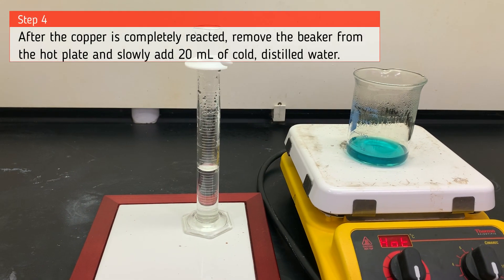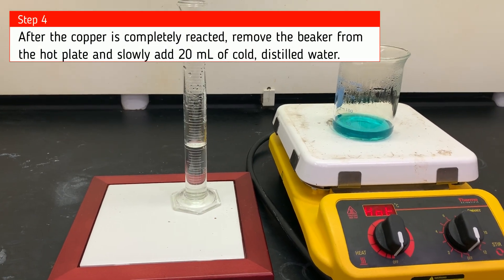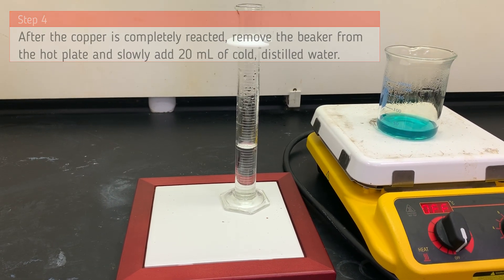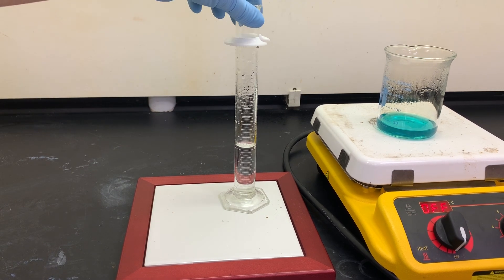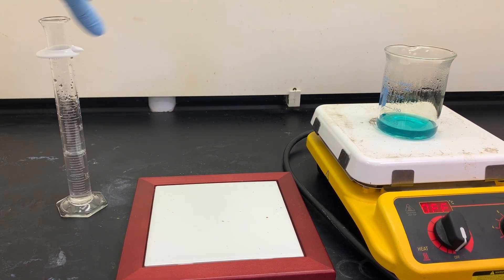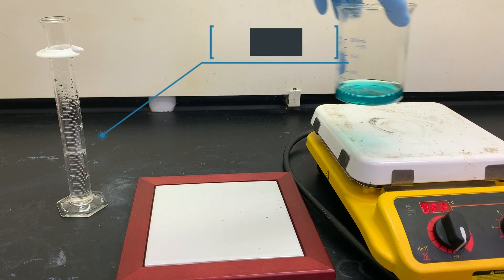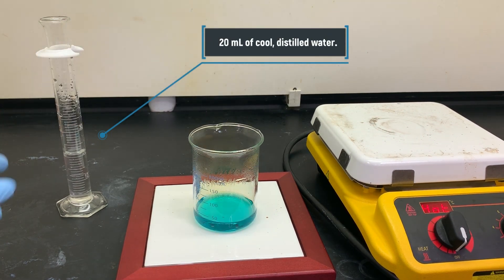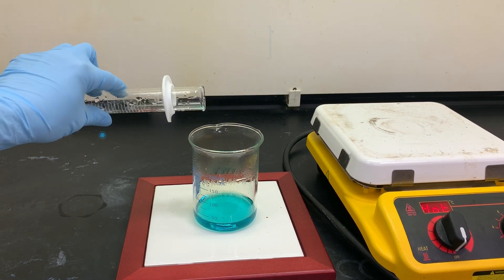Now that the copper is all reacted, we're going to remove the beaker from the hot plate and slowly add 20 milliliters of cold distilled water to our mixture. The water will not be participating in the reaction — the purpose of the water is just to cool and quench the reaction so it stops reacting.